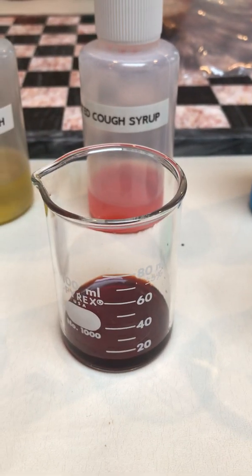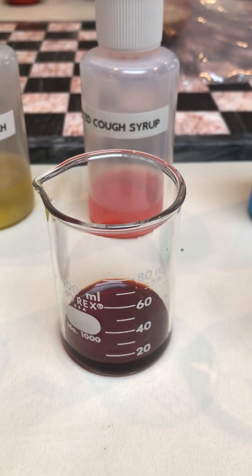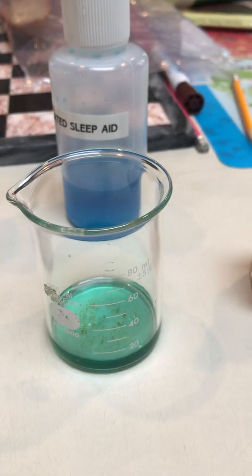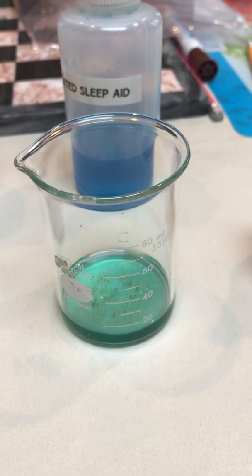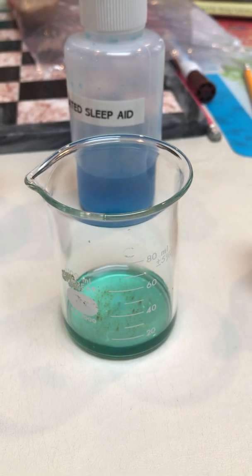Our cough syrup, which has started out light red, has also turned dark red! And our sleep aid, which has started out blue, also stays pretty much blue. Well, kind of greenish blue. Kind of greenish blue. You're right, Bridget.